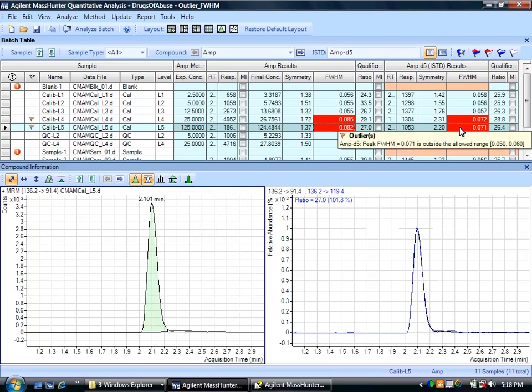And the qualifiers follow suit over here. They have the same peak shape, so that does make sense. So that's an example of using this particular chromatography metric, full width at half height maximum, setting that up to monitor the chromatography of the peaks that you're using for your quantitation.